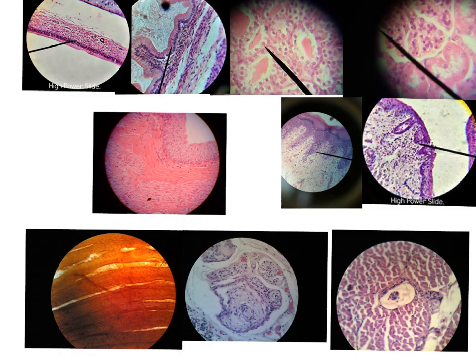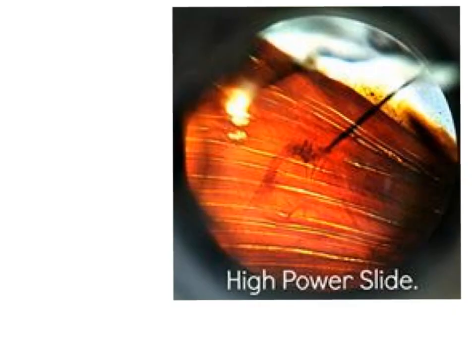That will be seen. The first slide is the most easy slide because of its characteristic color. It is the motor end plate. Between 2 brackets, AG, that's the special stain. Why is it the most easy slide? Because it is the only slide in the 10 high power slides stained by the brown color.